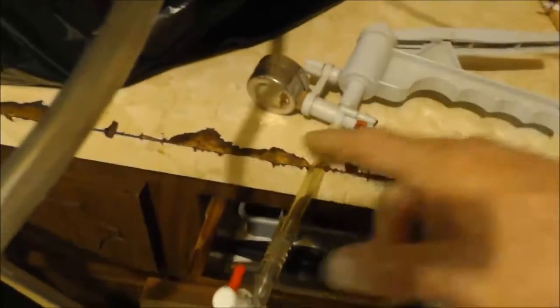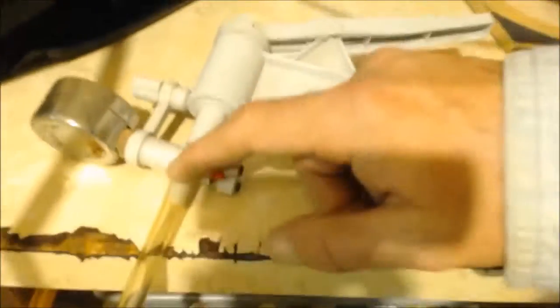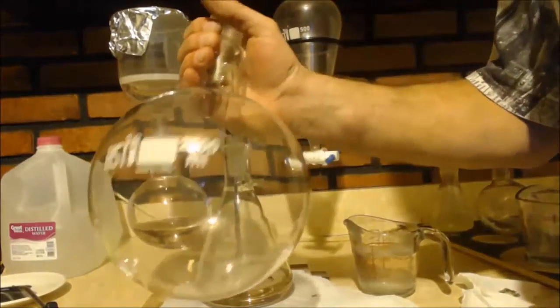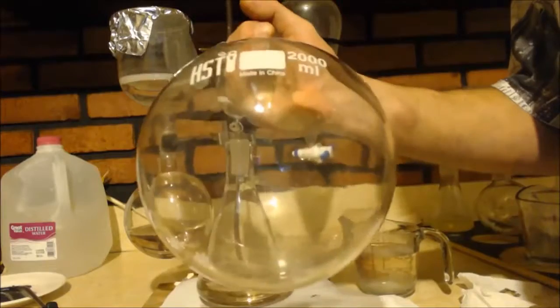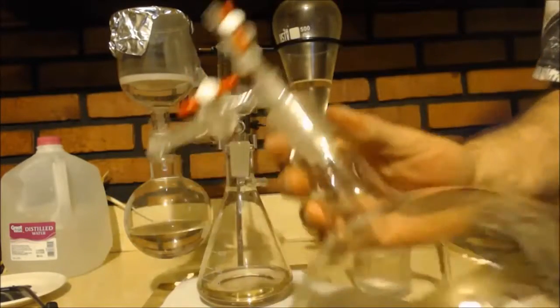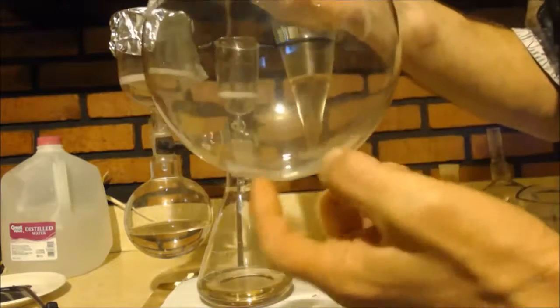Now on the pig, there's your out port to the atmosphere. I have a hose coming down to these two valves, goes into the giant round bottom flask and back out to my pump, my hand pump. Now the reason I did that, I didn't just connect my pump up directly, is because I want the valves. If I need to take this off, you know what I mean? I just have to pull the hose off and the whole vacuum just drops like that. If I got a valve, I can do it little at a time.